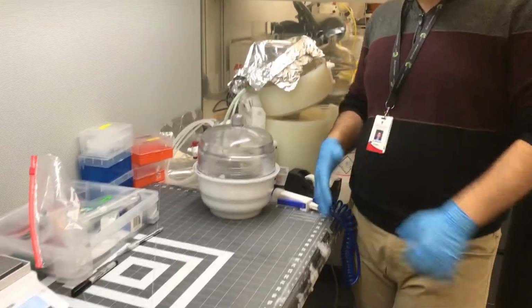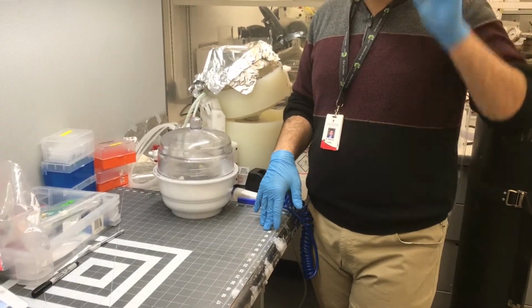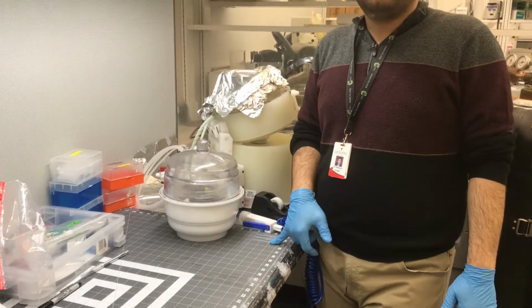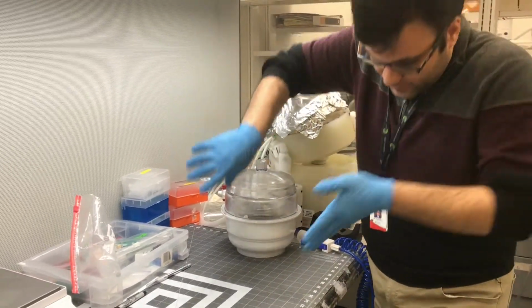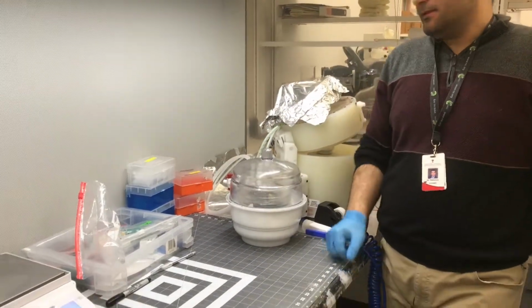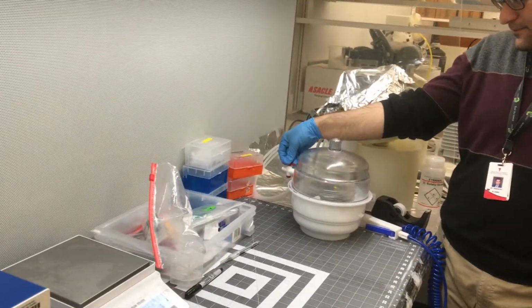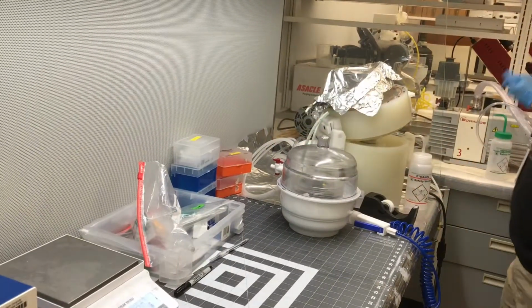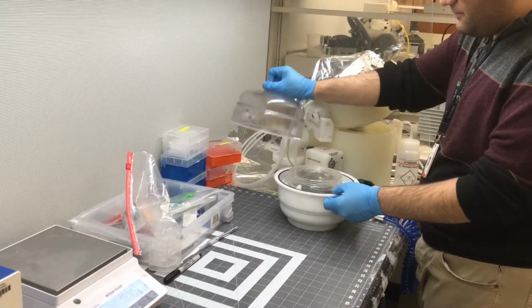And the point is, when you add the PDMS cross-link mixture faster on top of the master mold, there will be less air trapped. Because if you put it slowly, the air goes inside gradually also. Whatever you add, air also goes inside. So when you finish and reach this point, you just remove all this, and also turn off the pump, remove this thing.